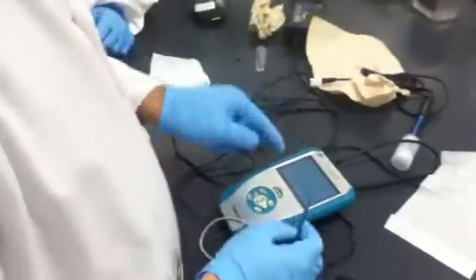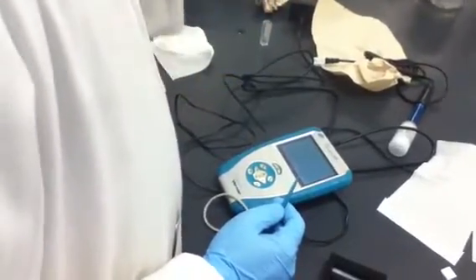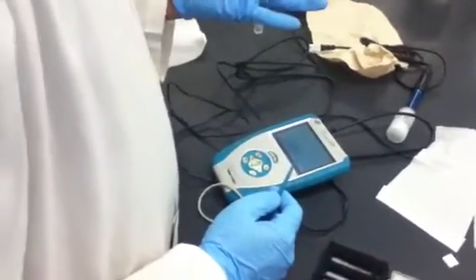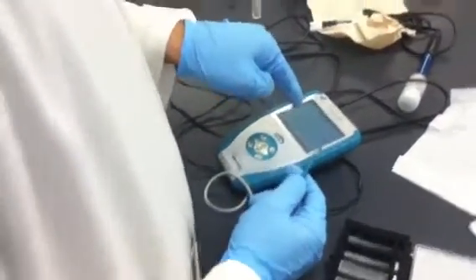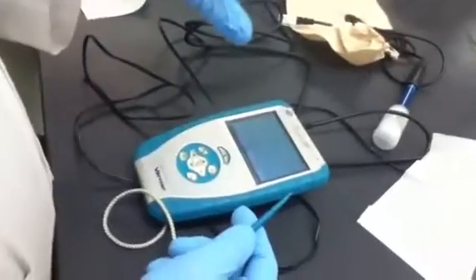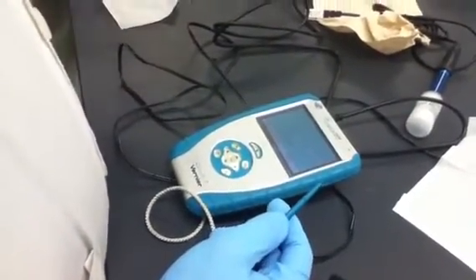So what it does is warming up, so the light warms up, right? Then it will tell me to place solvent, something like this. I forgot what the message is. Oh, it will tell you to place a blank cuvette in the device. So blank cuvette means the blank is either water or toluene that we use in this case, so that it can subtract. Then I have to put it in.